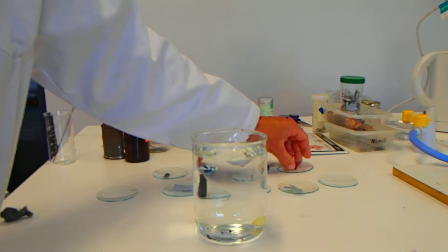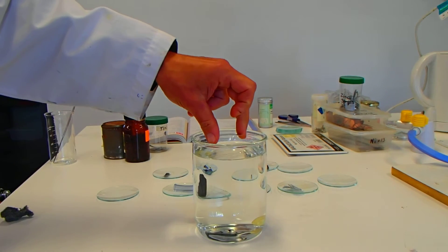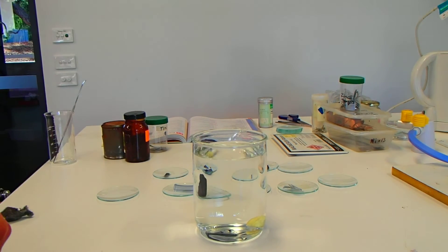Let's have a look for the zinc. Float that on the surface. Nope, straight to the bottom as well.